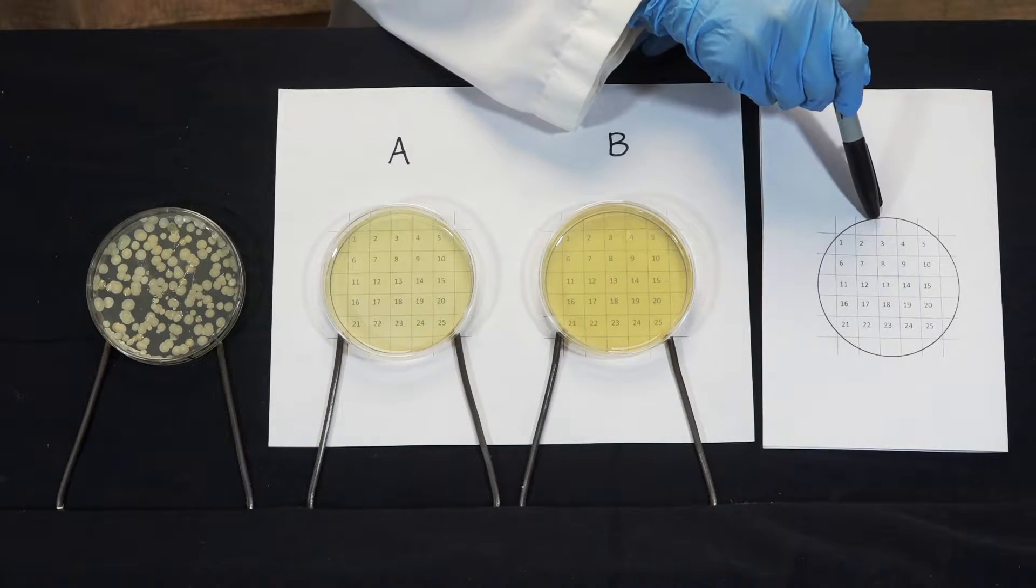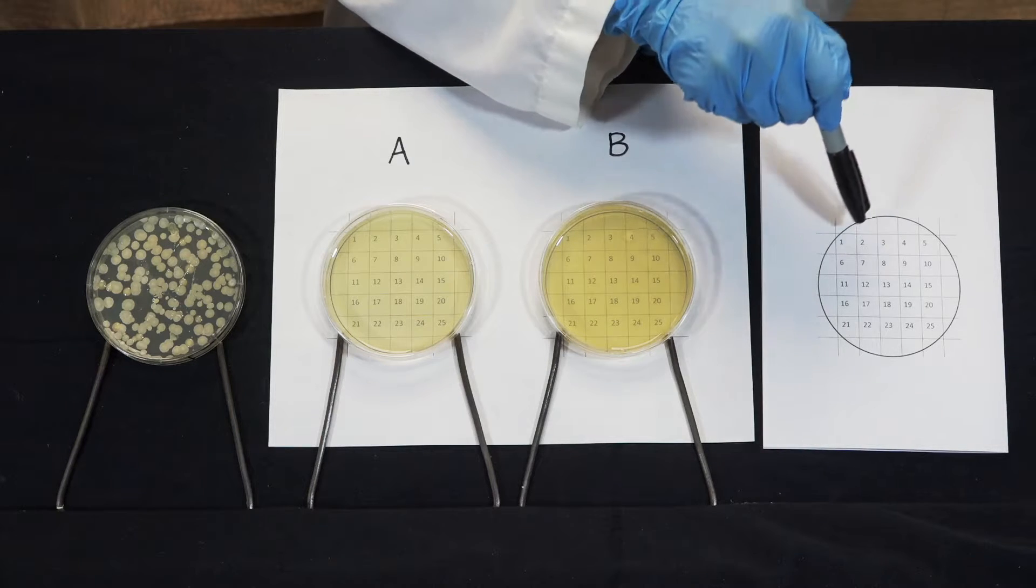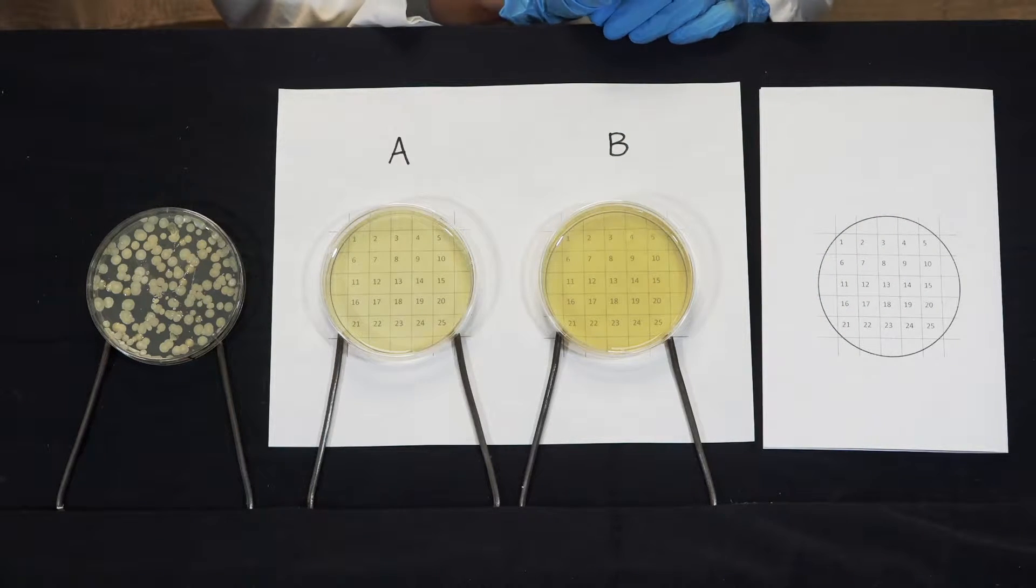Over here we have an extra copy of the grid for marking off the plates as we go.